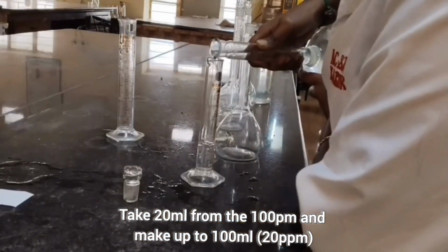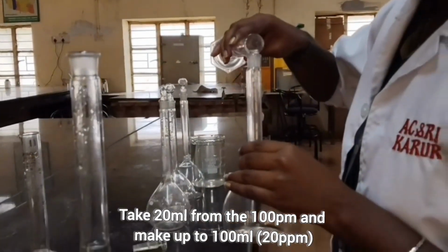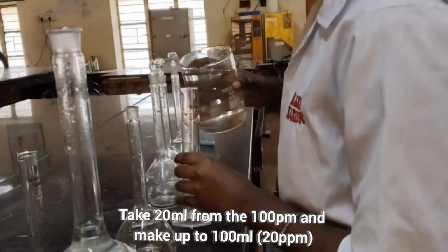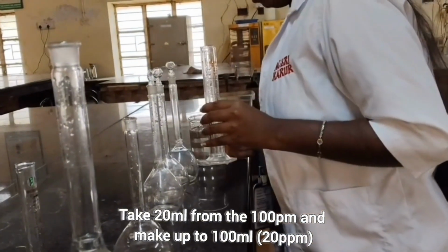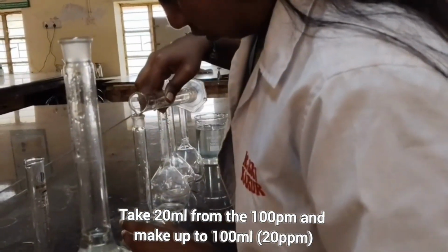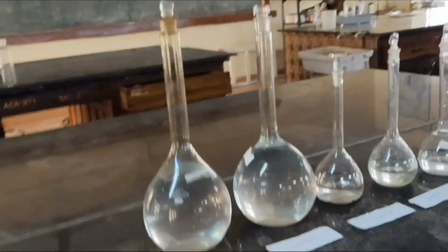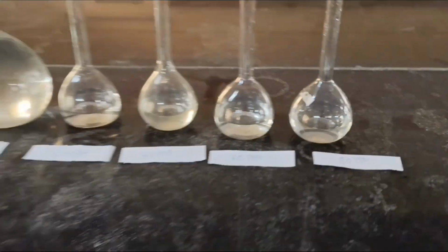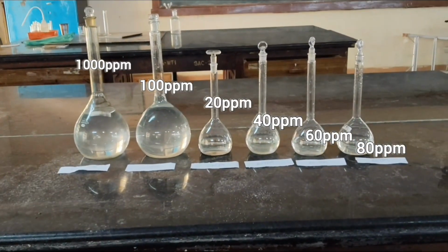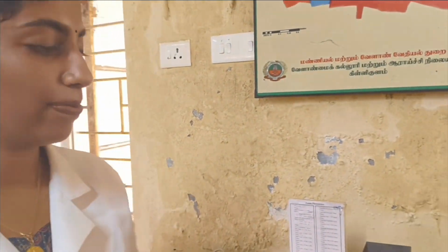Measure 20 ml from the 100 ppm sodium solution. Make up the volume to 100 ml using distilled water. This gives 20 ppm standard solution. Similarly, prepare 40, 60, 80 ppm of standard solution. Now we'll go for calibration of the flame photometer and sample analysis.